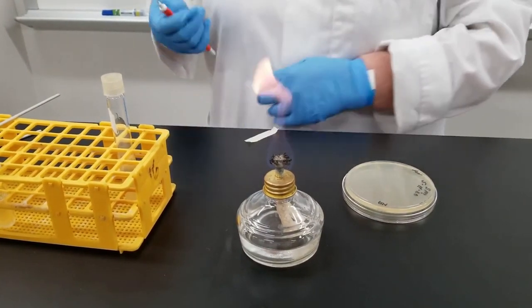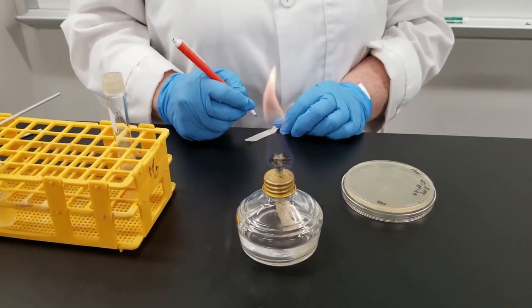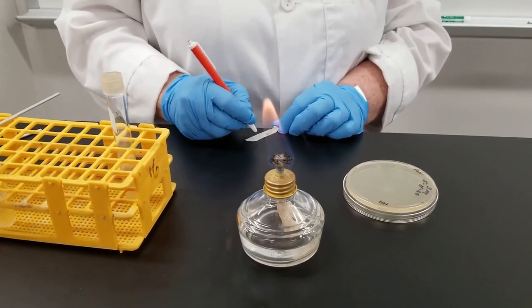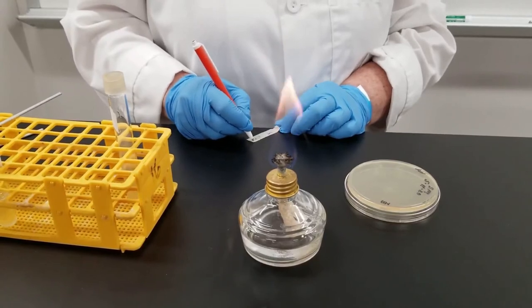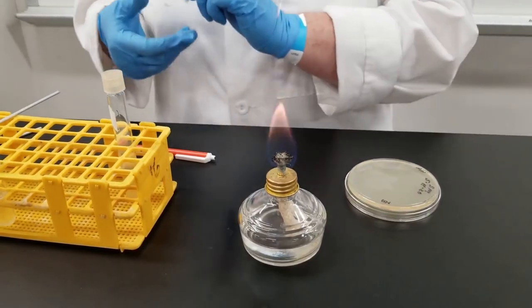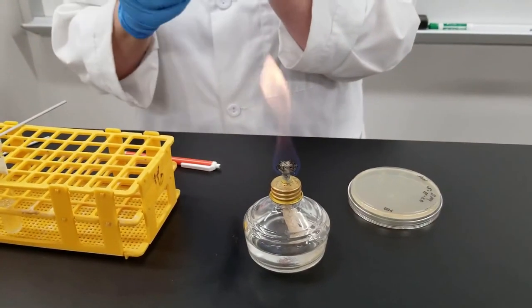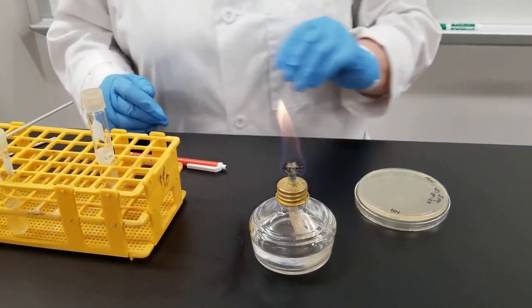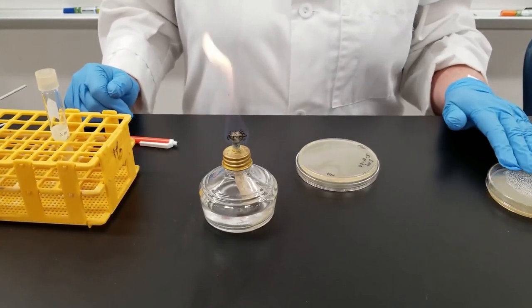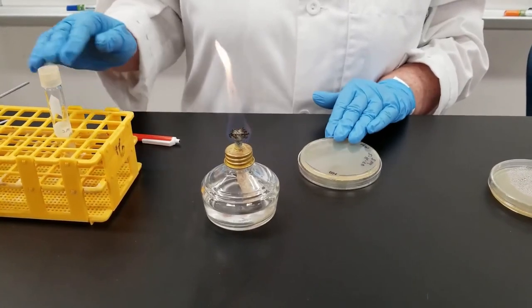And we will go for 24 hours. Sometimes you may need to go for 48 hours. Once again, it depends on what test you are using. So on my label, once again, I am going to put the organism. I am going to put the date. And I am going to put my initials on here. And we will just place that on the tube. Once again, that way there is no question about what is on your sample. So that is how you would go from a solid medium to a solid. I showed you both with a plate and with a slant.